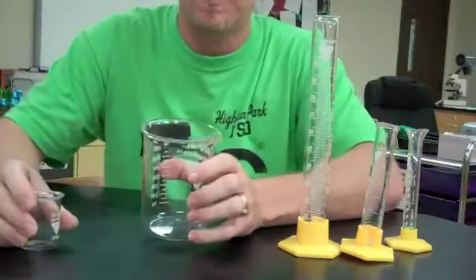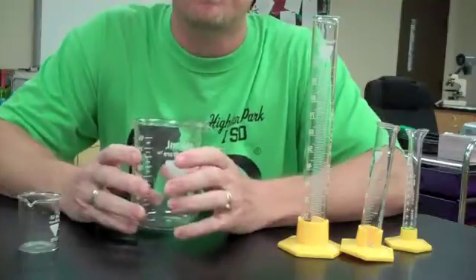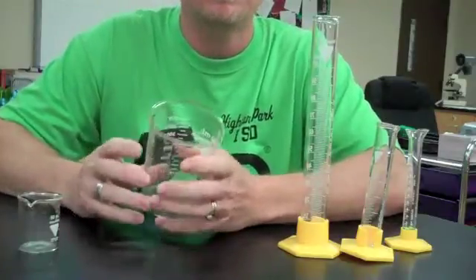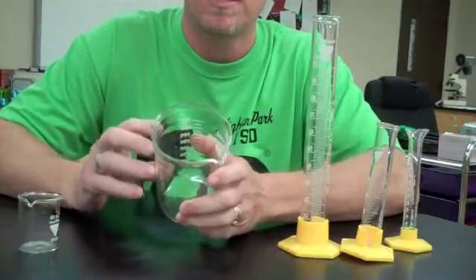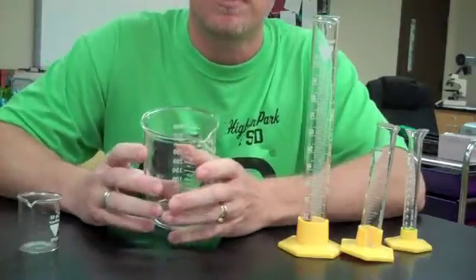Hi, I want to talk to you guys about accuracy and precision today. We're going to do this with a little look at some of the glassware that we use in chemistry.